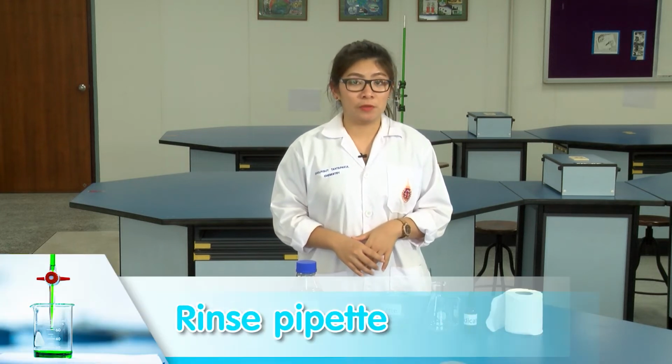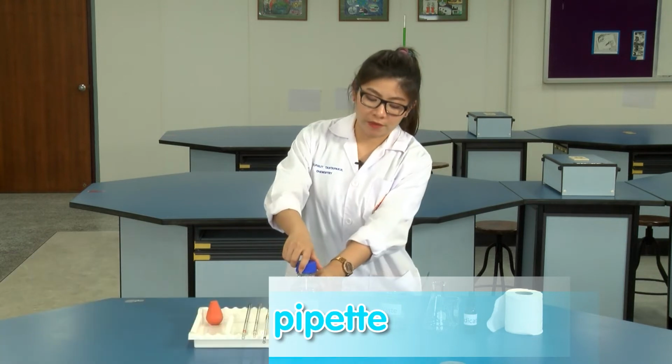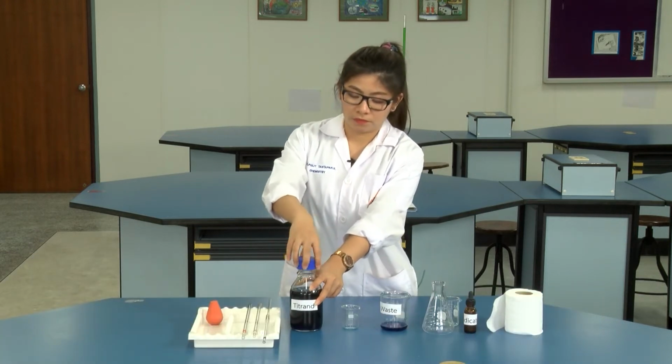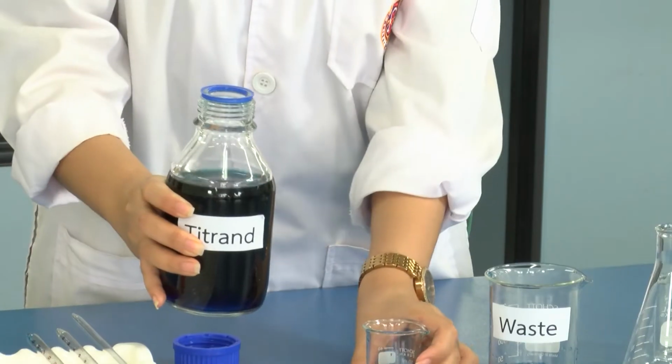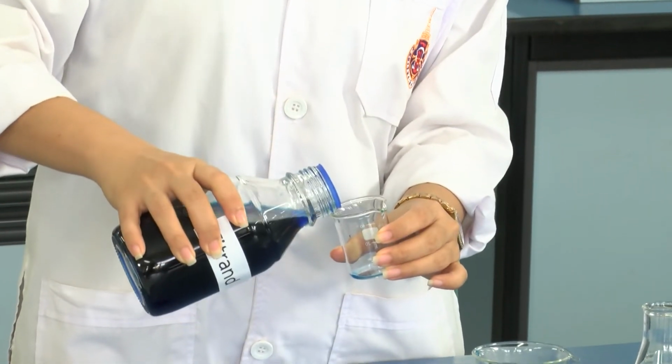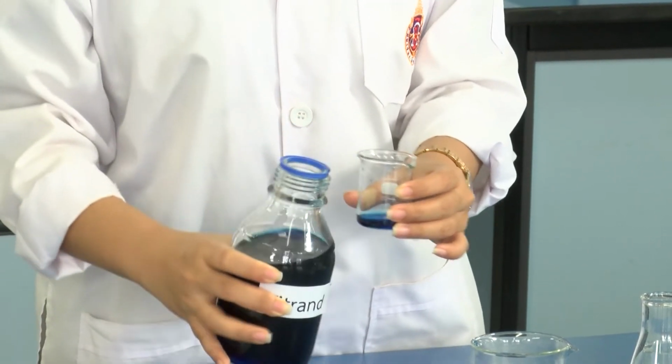For the next step, we're going to prepare the sample solution with unknown concentration. First of all, we need to rinse the pipette. Transfer the sample solution, just a small amount.